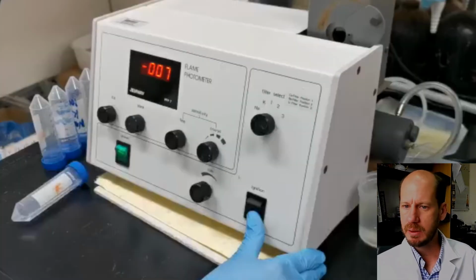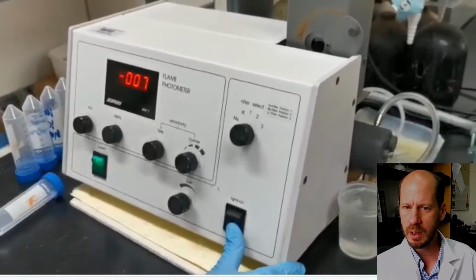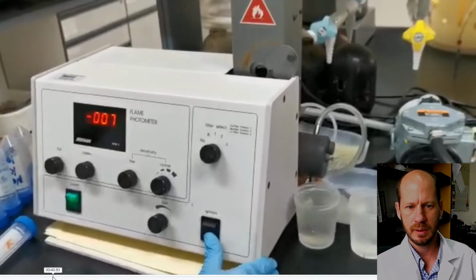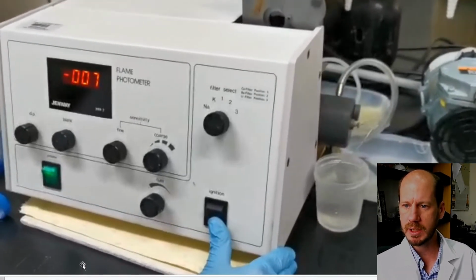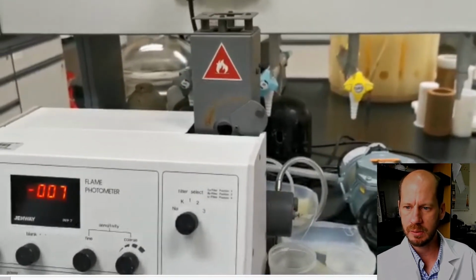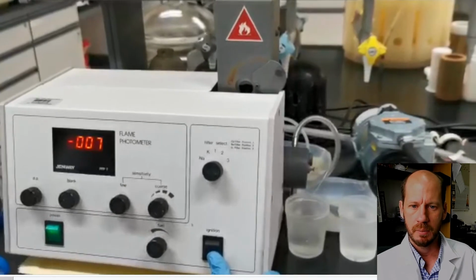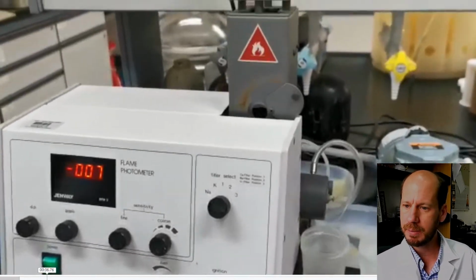So the potassium measurement is the same measurement as we did for soil extract. For more details, please watch the video on potassium on soil extract and potassium bioavailability to plants. But now we are actually doing the same thing, but only for the plant material.